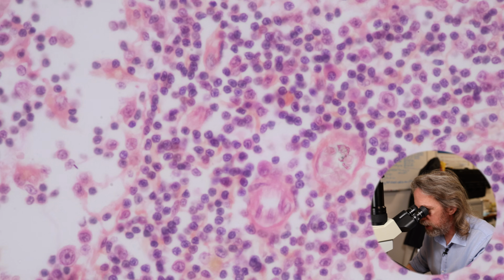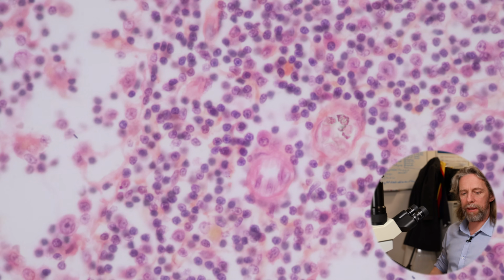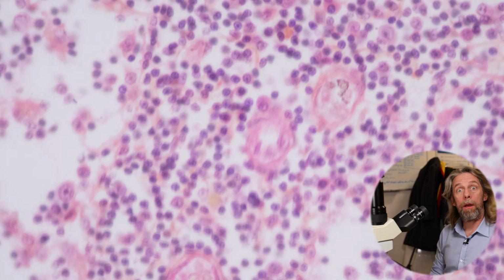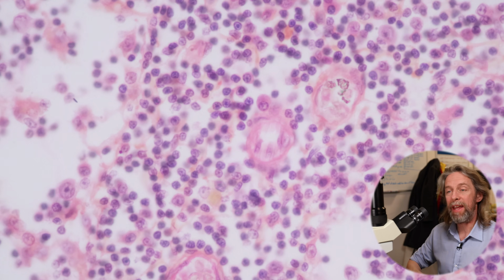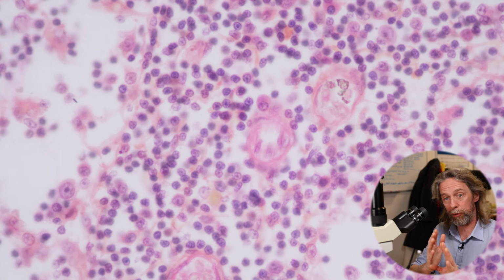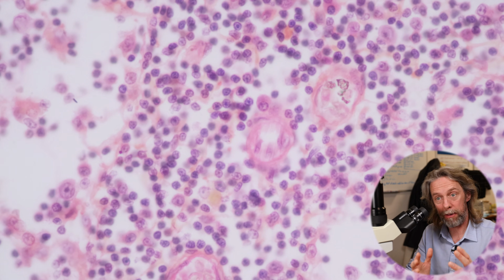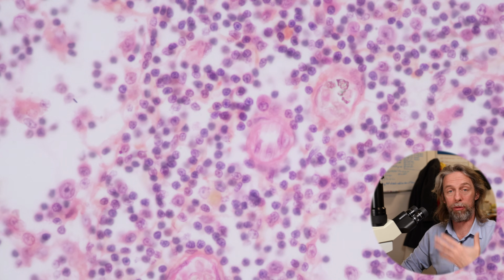And there are specialized regions of these blood vessels, these high endothelial venules, where the endothelial cells lining the inside of the tube are thicker, more cuboidal. And the specialization here is that lymphocytes can use these high endothelial venules to pass between the lymph node and the blood, because we have lymphocytes circulating around the body in the blood and passing through the lymphatic vessels.